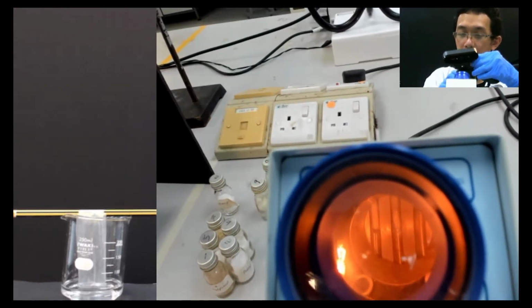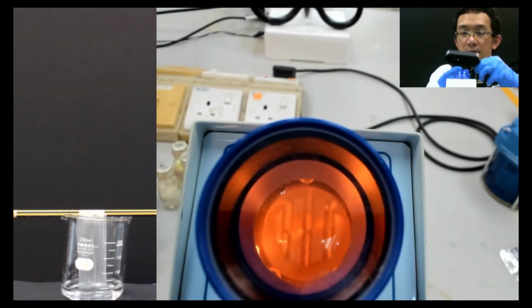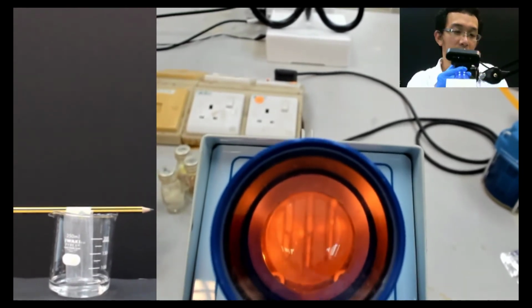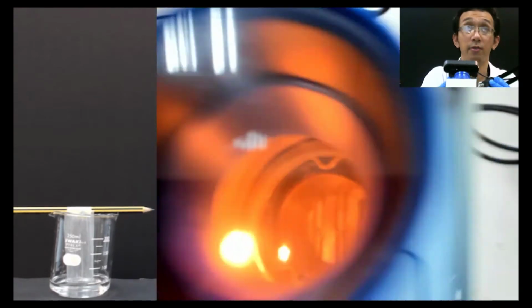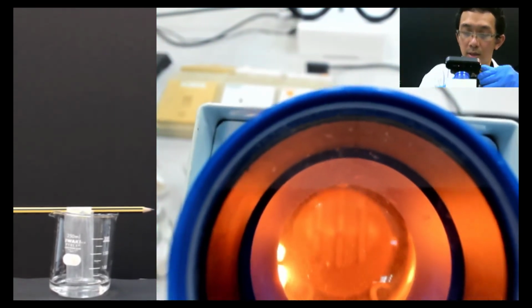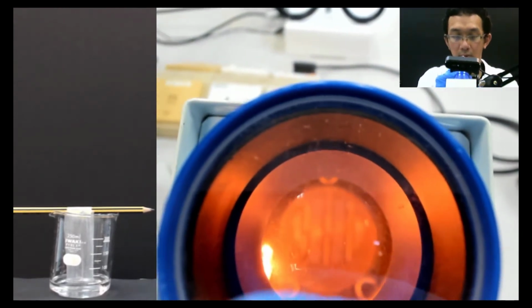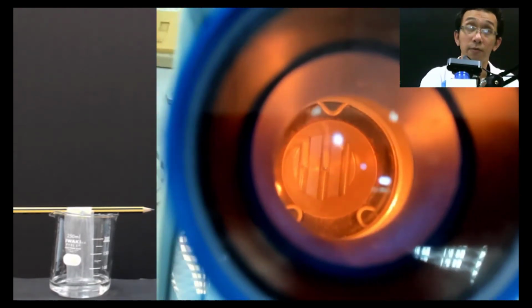It takes a little bit of time here, so bear with me for a while, because I have only a few webcams, so I cannot have this fixed to something else. So I think this is just this one.